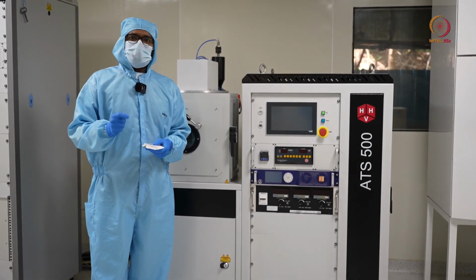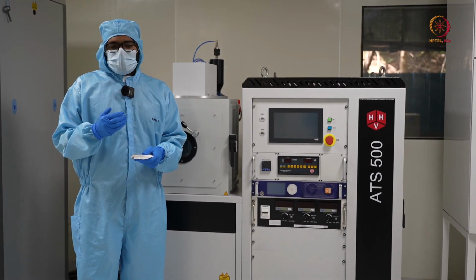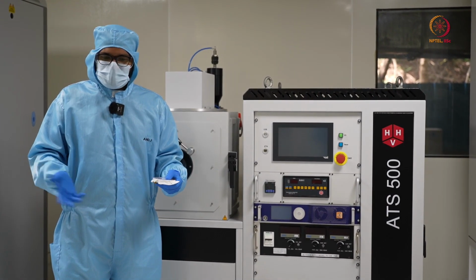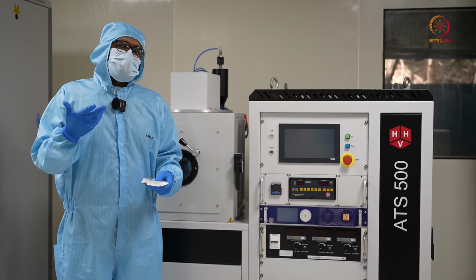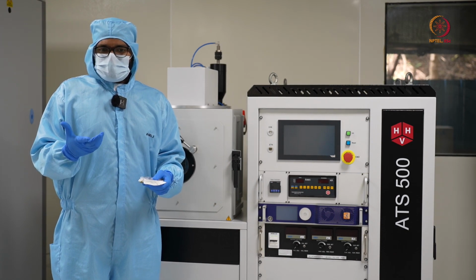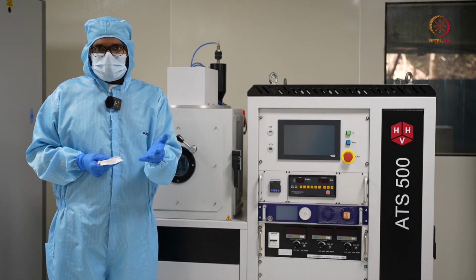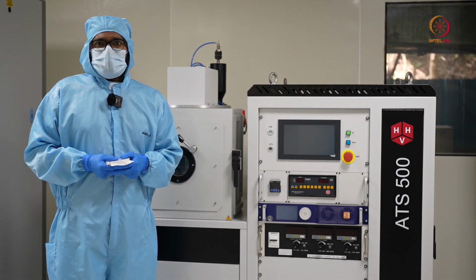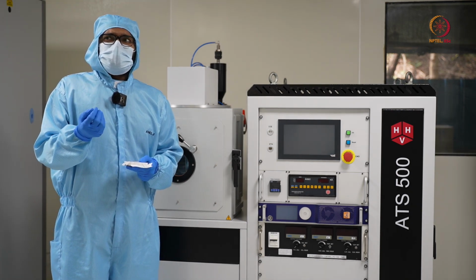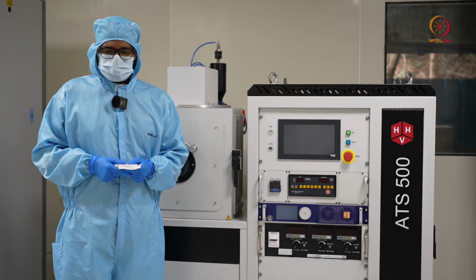towards this electrode, it will encounter other argon atoms and it will collide. Due to this physical collision, some more argon atoms might split into electrons and argon ions. This continues like a chain reaction, and ultimately you have a steady state where you have a sustained plasma. The bunch of argon ions moving towards this electrode will create what is called a plasma, and the indication is usually some purplish glow that you will see near the electrode.